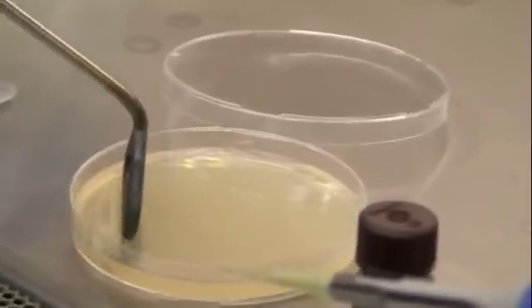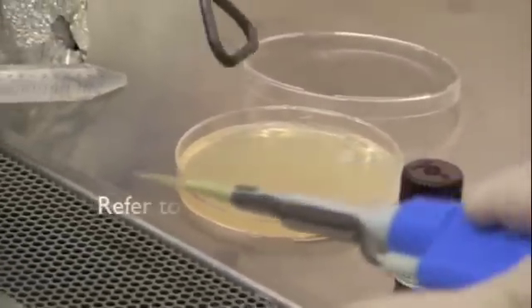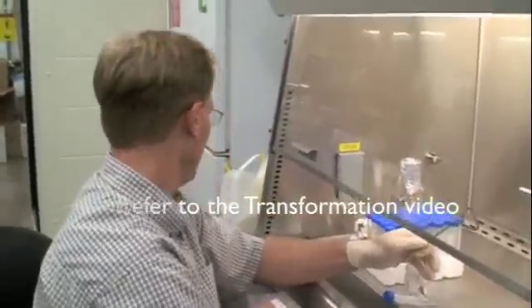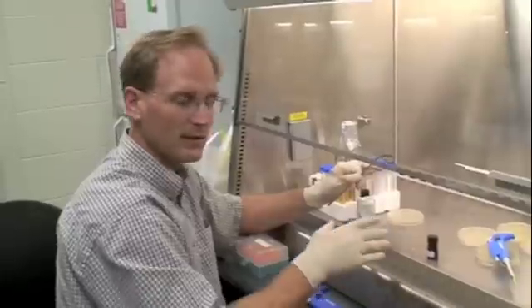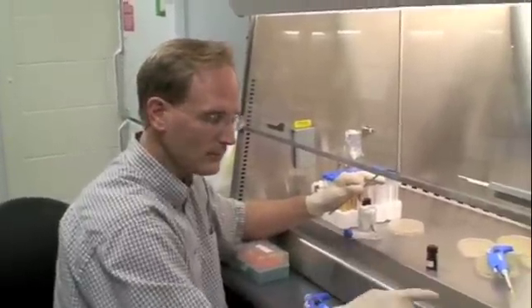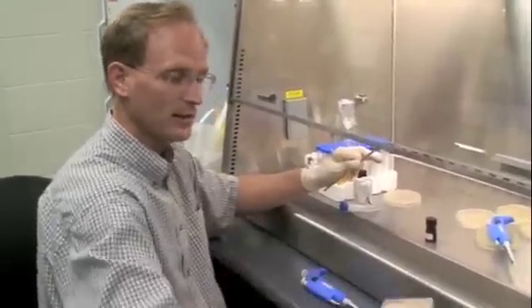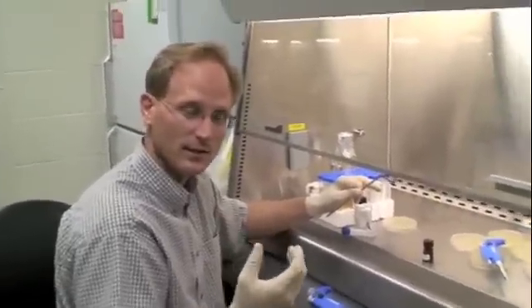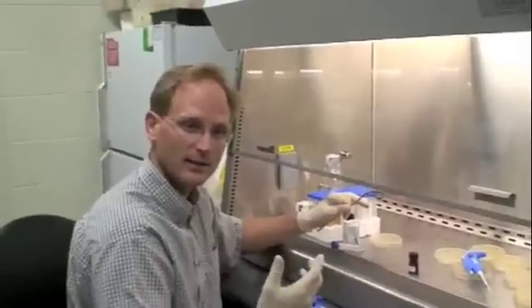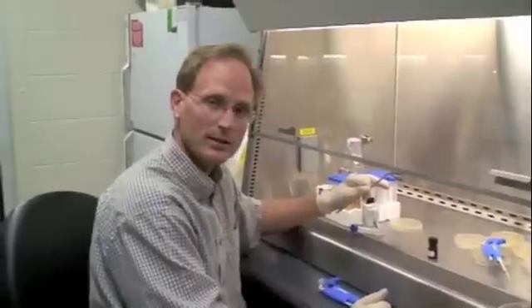That'll take a little while for the reagents to absorb into the plate. Recall we have an hour while we're waiting for the incubation in SOC. Once these plates have all been treated, I'm going to move them into the 37-degree incubator. Ideally, we want to put the SOC cells — which have probably only gone through one or two cell divisions — onto warm plates. The new cells in that SOC media should be intact and not fragile like the competent cells were.